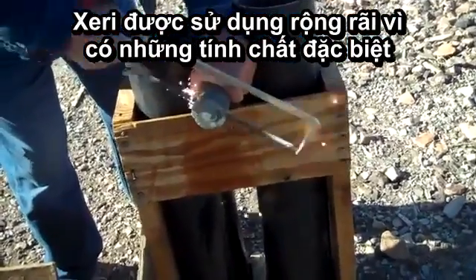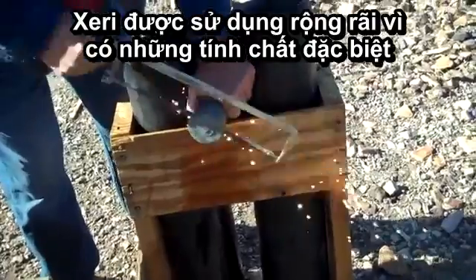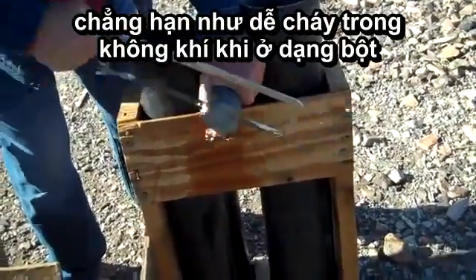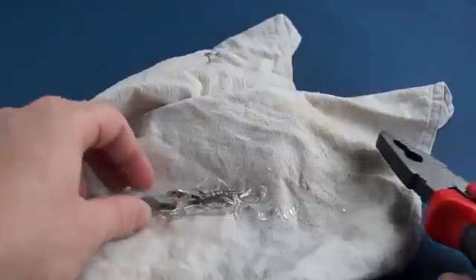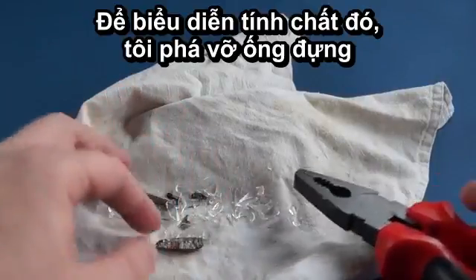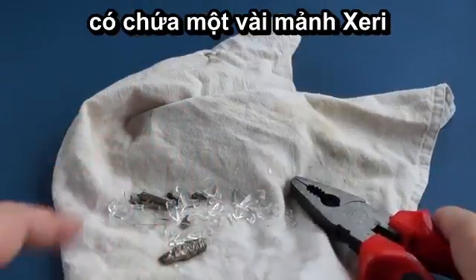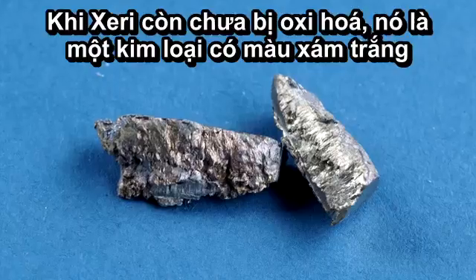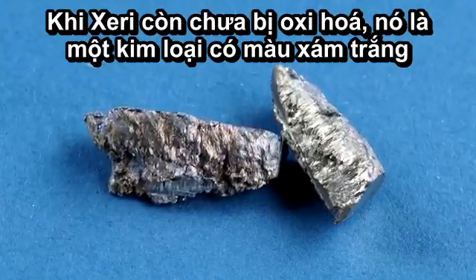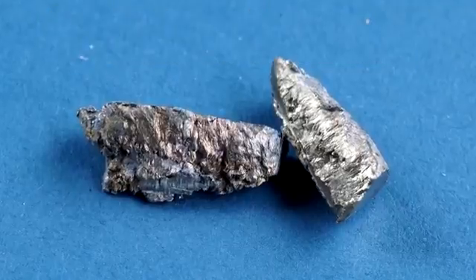Cerium is widely used due to its pyrophoric properties, i.e. spontaneous combustion in air as dust. To demonstrate this property, I'll break the ampule that contains pieces of cerium. In appearance, the unoxidized cerium from the ampule is a shiny metal which has a crystalline structure.